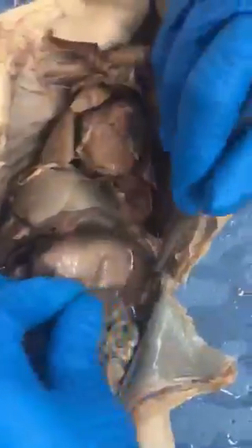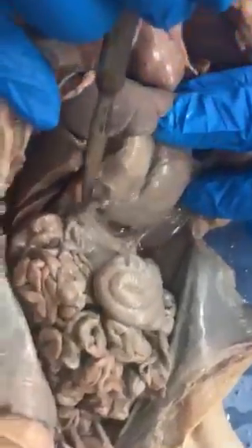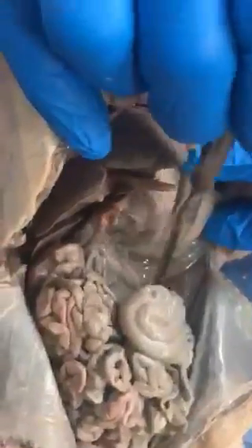This is the spleen, which looks like a tongue in the pig rather than a fist, what it looks like in humans. So spleen. Below and behind the stomach and retroperitoneal, meaning I'm breaking the parietal peritoneum to expose it a little bit more, is the pancreas, kind of grainy looking structure here. The duodenum goes to small intestine in general. All of this tube is small intestine.